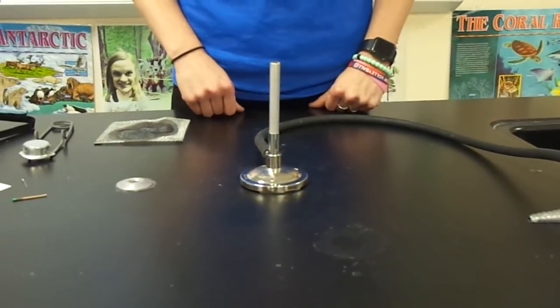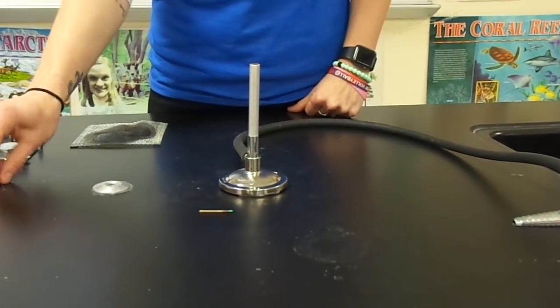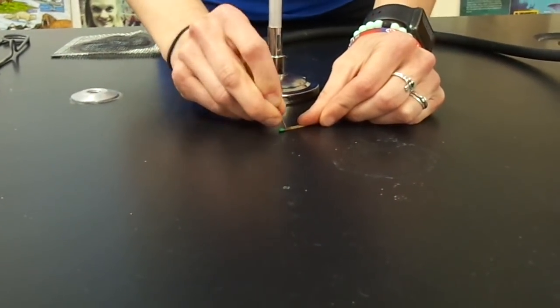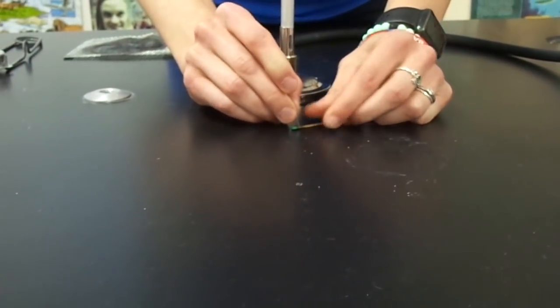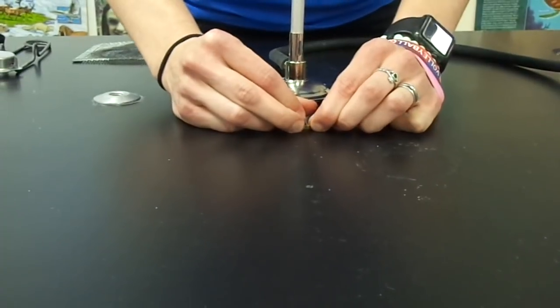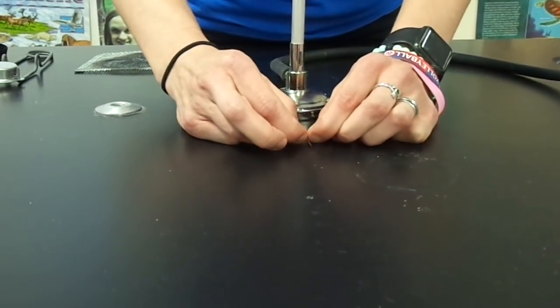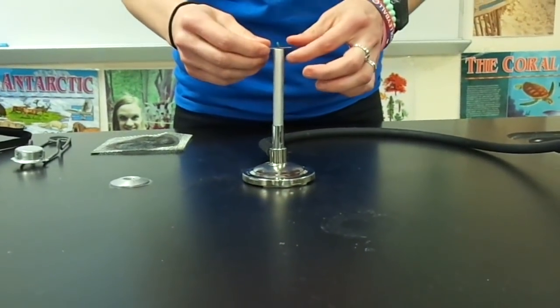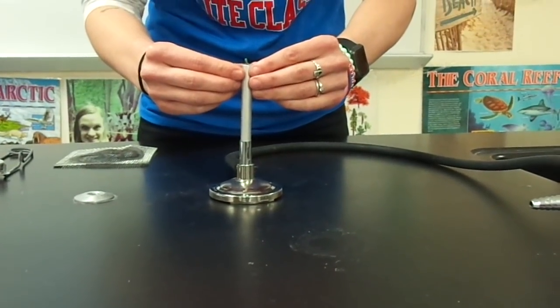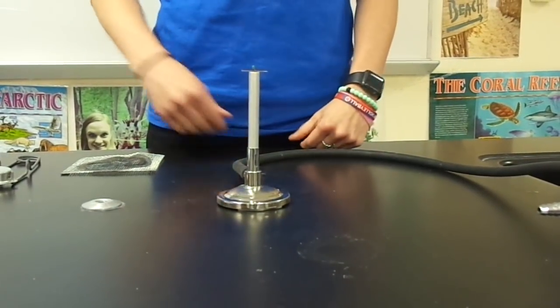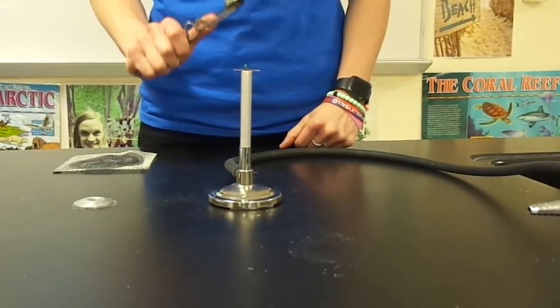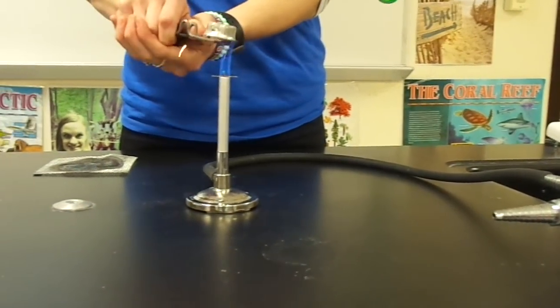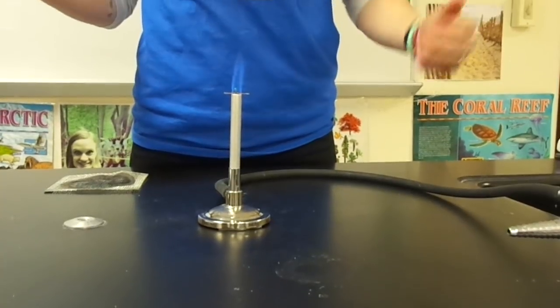The last part of the lab is a little bit of a challenge. You're going to need a match and a pin. You're going to place the pin through the match. Start by putting pressure on the pin towards the top of the match. Once you have a hole started you're able to very carefully push the pin through the match making a T shape. Then carefully place your match in your Bunsen burner. The goal is to turn the gas line on. Good luck!